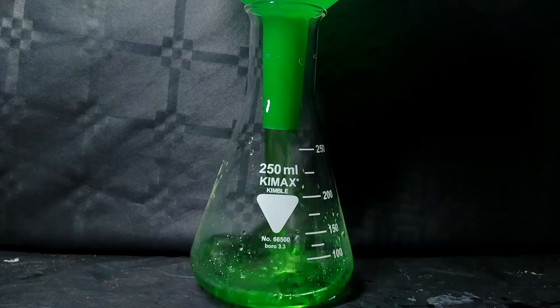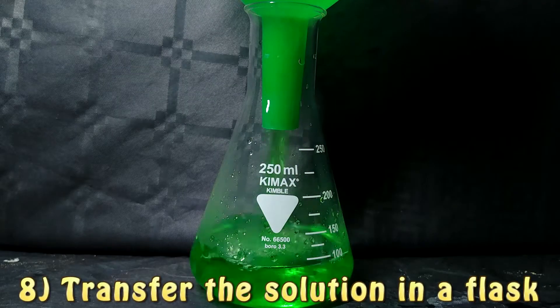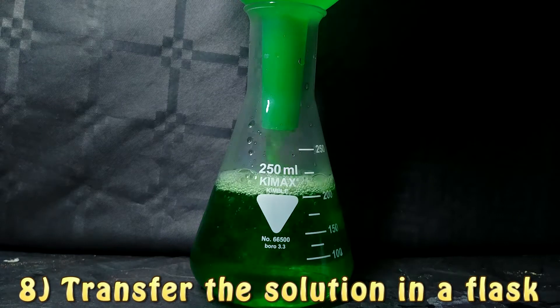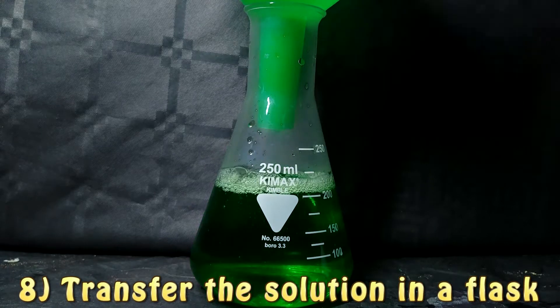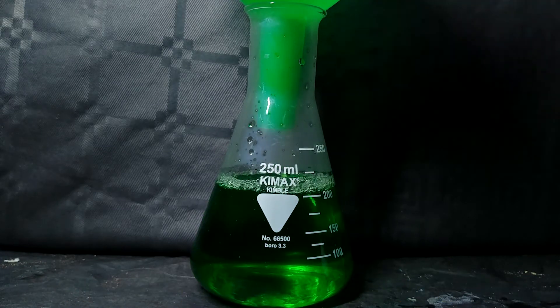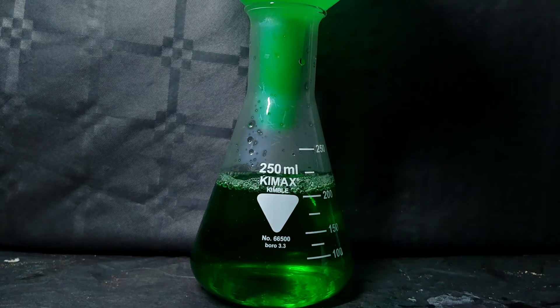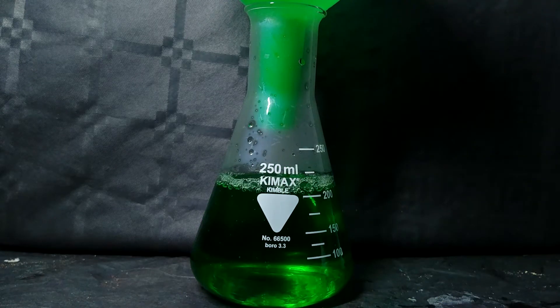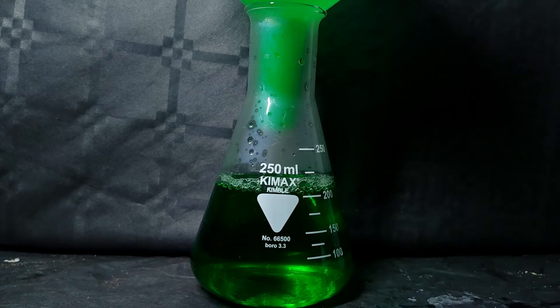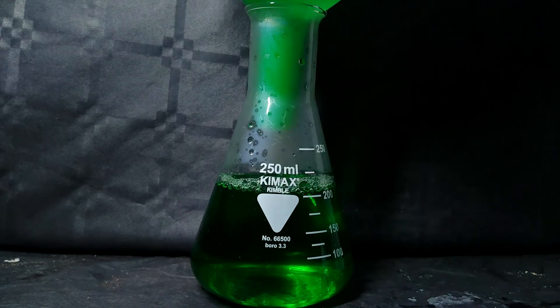We use an excess of hydrochloric acid because, as we will see later, this excess will be important — it reacts with aluminum foil, so it is already present in our solution.